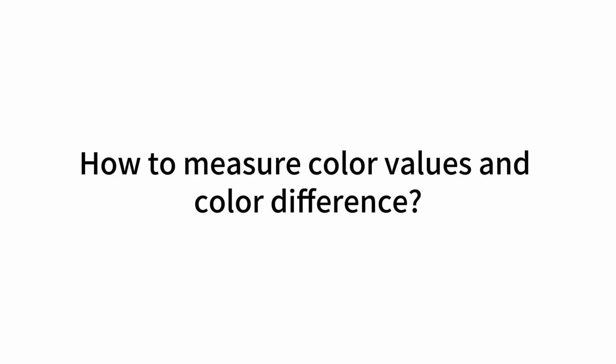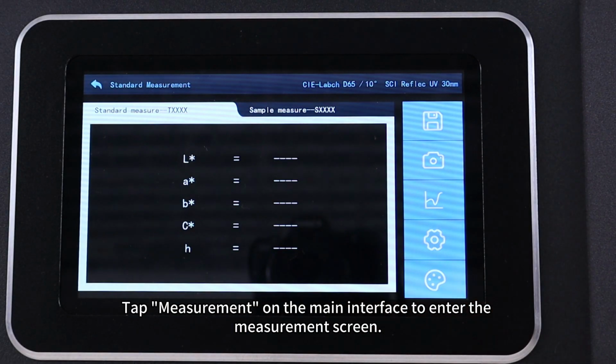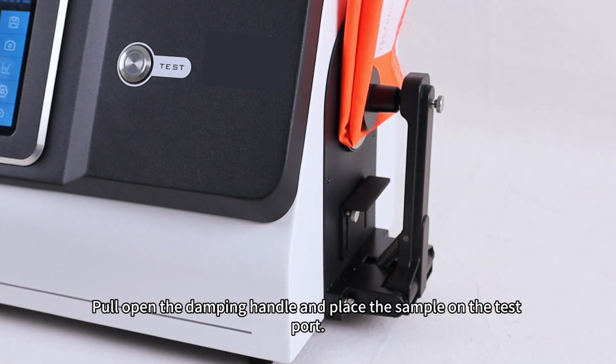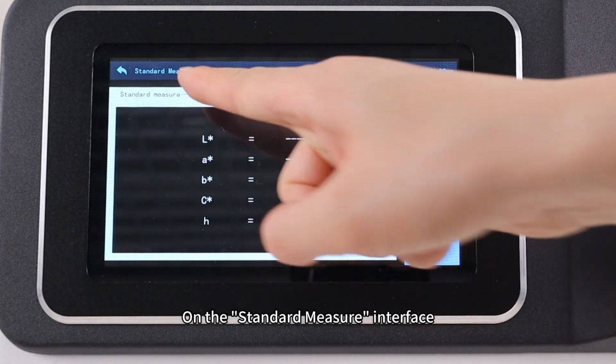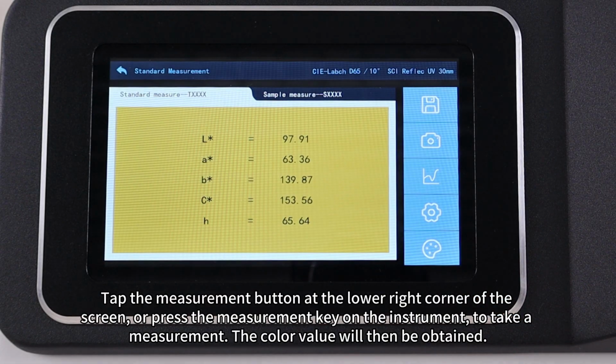2. Measurement. How to measure color values and color differences. Tap Measurement on the main interface to enter the measurement screen. Pull open the damping handle and place the sample on the test port. On the Standard Measures interface, tap the Measurement button at the lower right corner of the screen, or press the measurement key on the instrument to take a measurement. The color value will then be obtained.